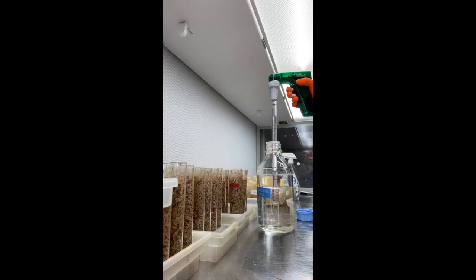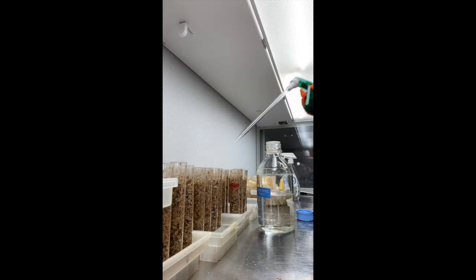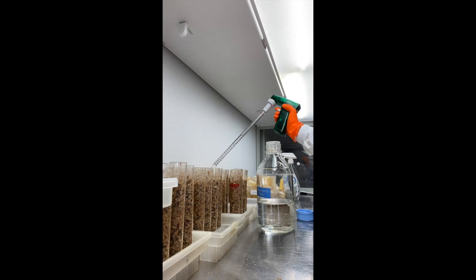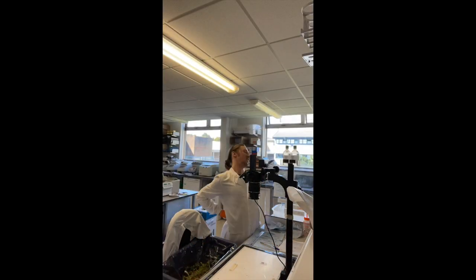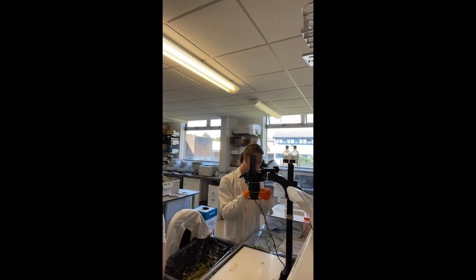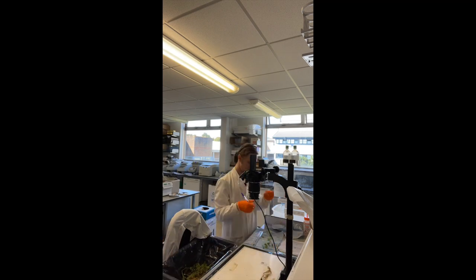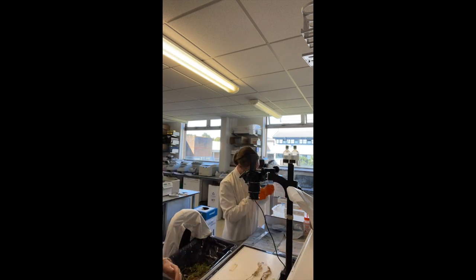After that, I inoculated them with spores, or if there were controls, just with water, and then we let them grow to see how their symptoms developed. We had at least six replicates of each of the 150 lines, and we washed each plant, took pictures of them, and scored them from one to five depending on the severity of the symptoms they exhibited.